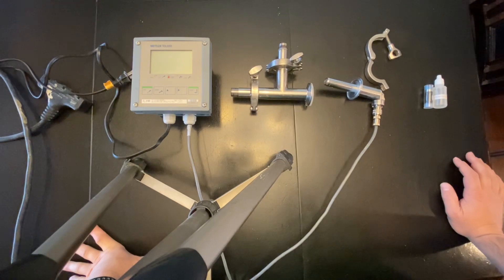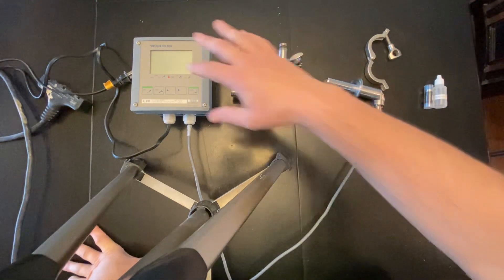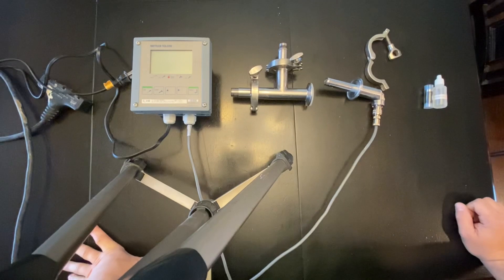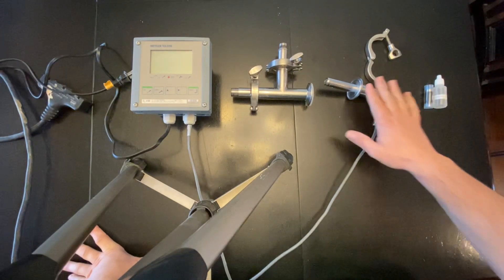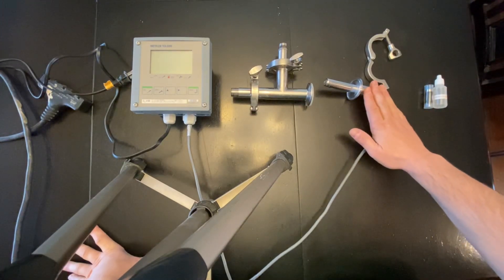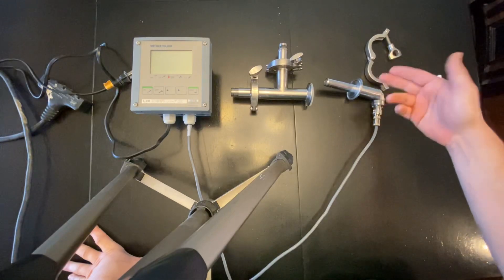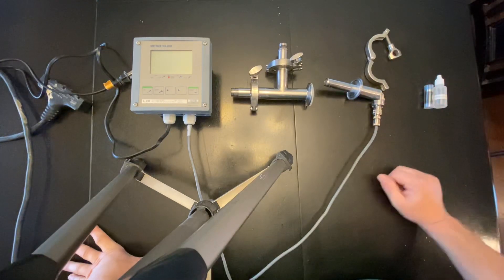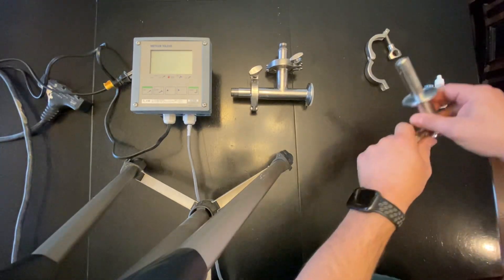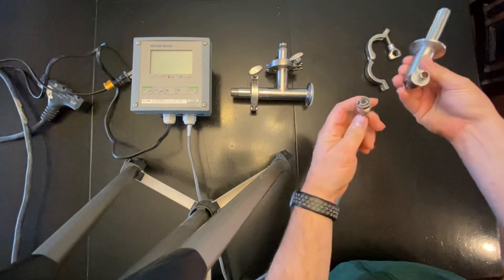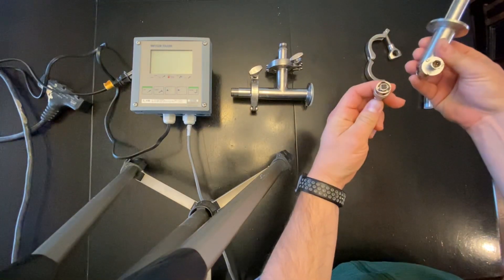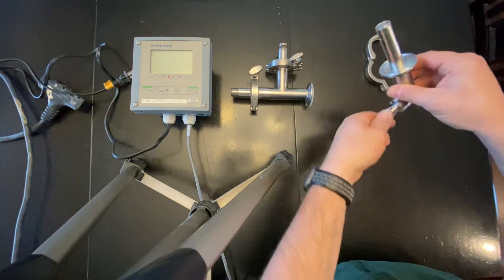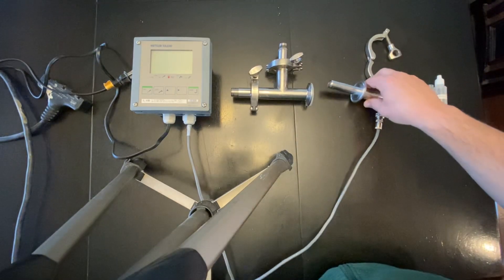What you have here is the transmitter, the Mettler Toledo transmitter right here. Itself is the DO meter. This DO meter has a sanitary flange TC fitting. The connection to the DO meter is kind of like a swivel lock connection, so you push this in and you give it a turn like that and it is connected.